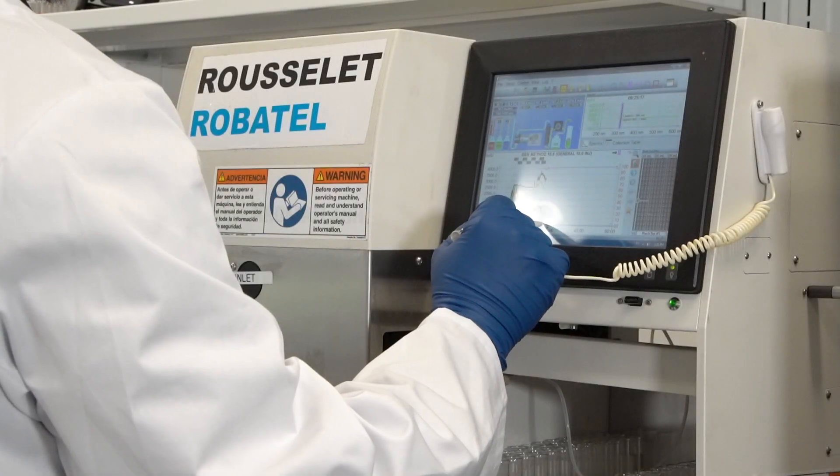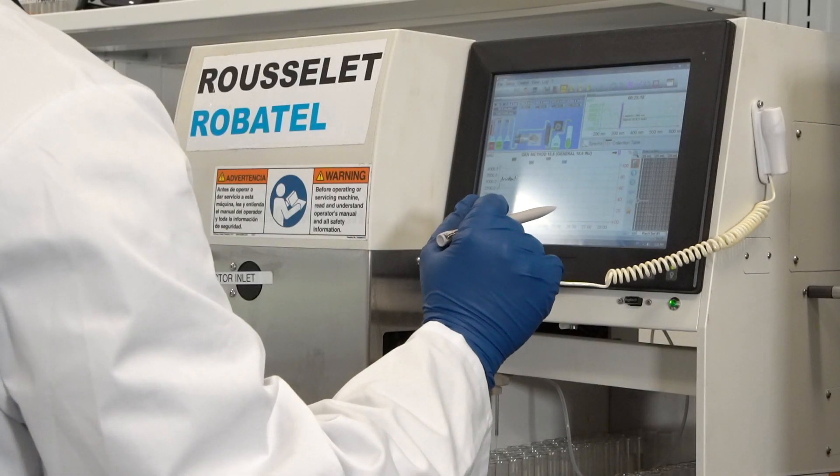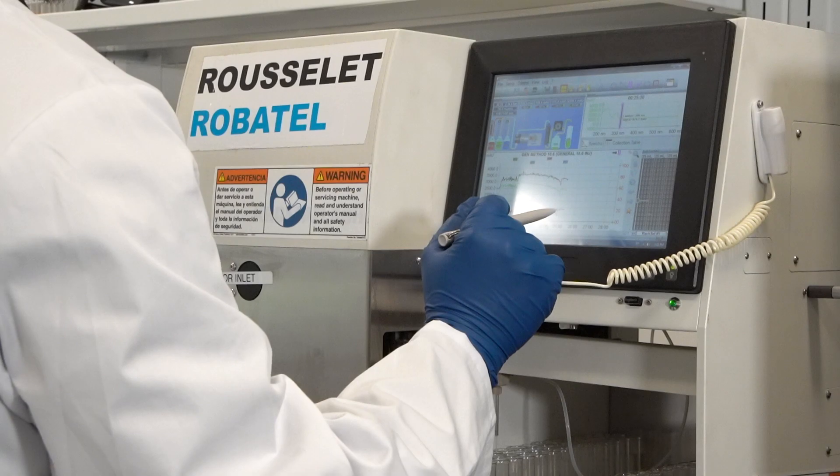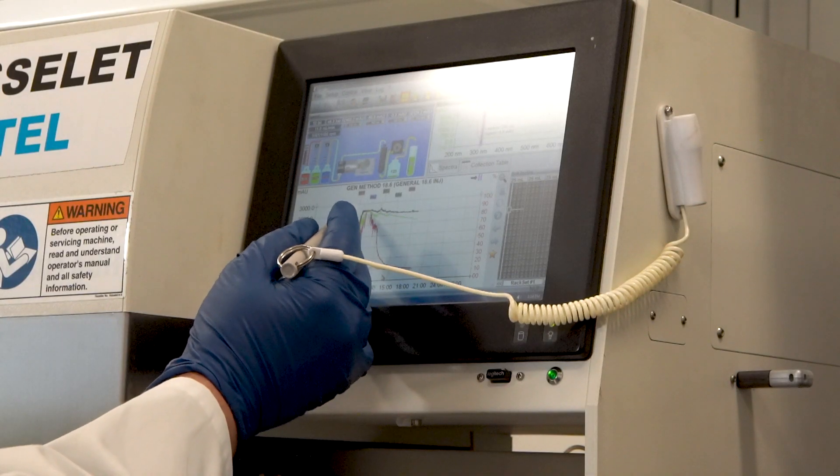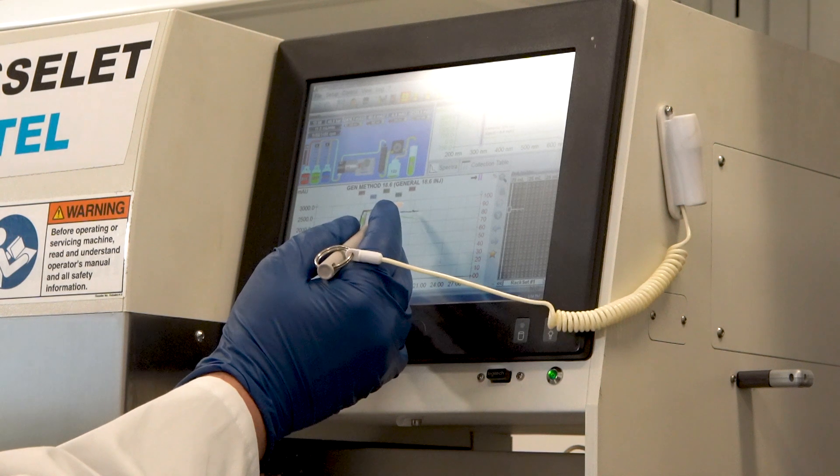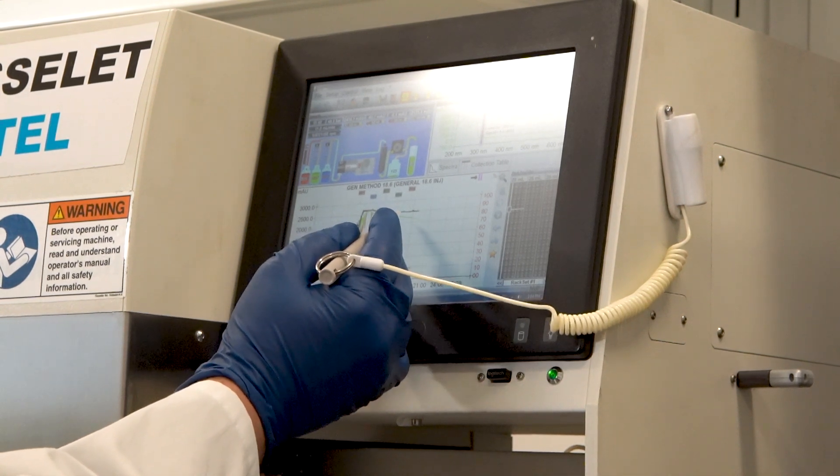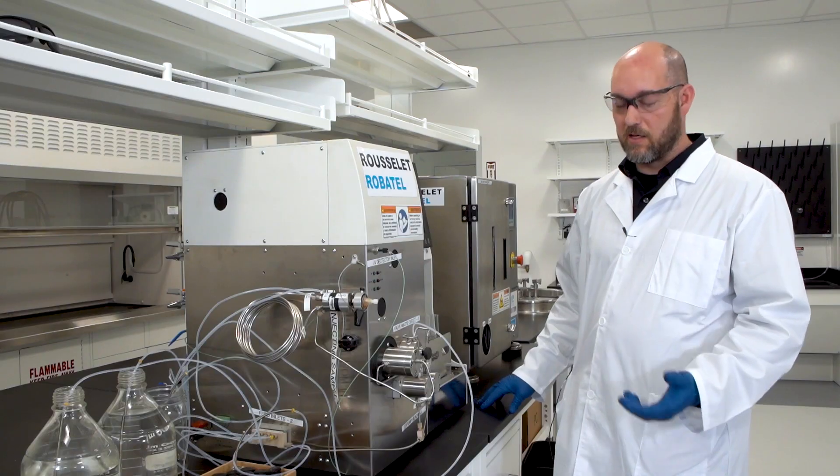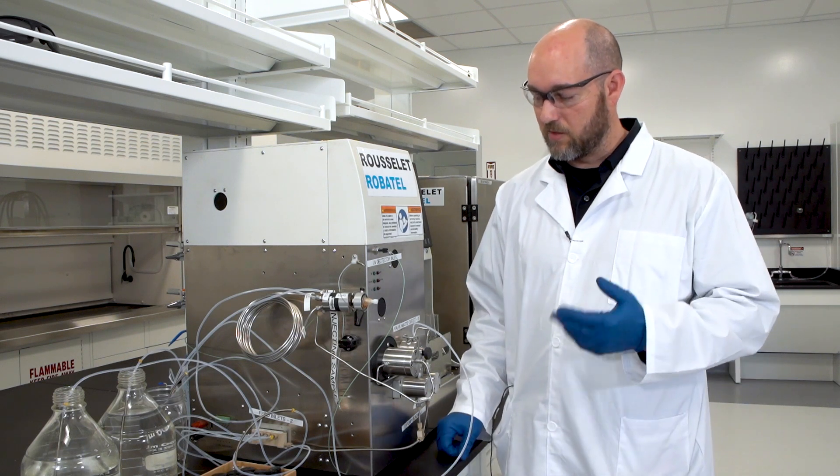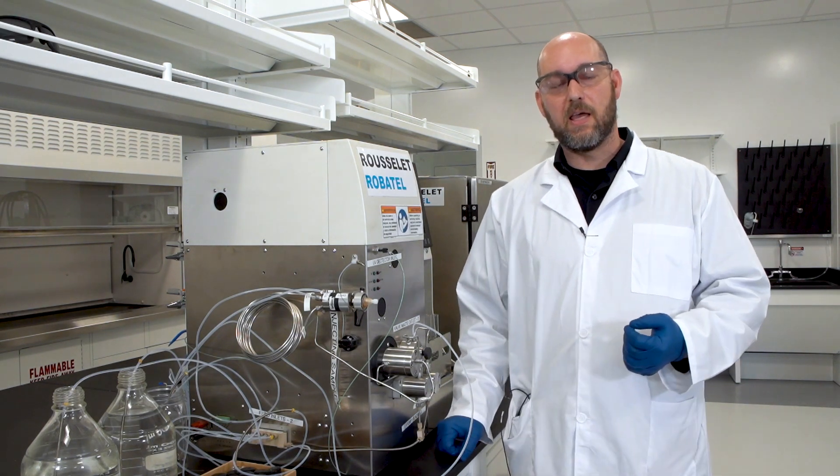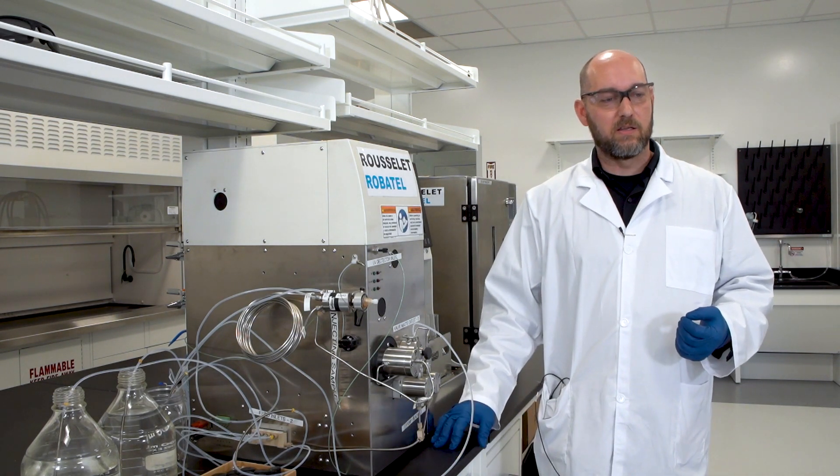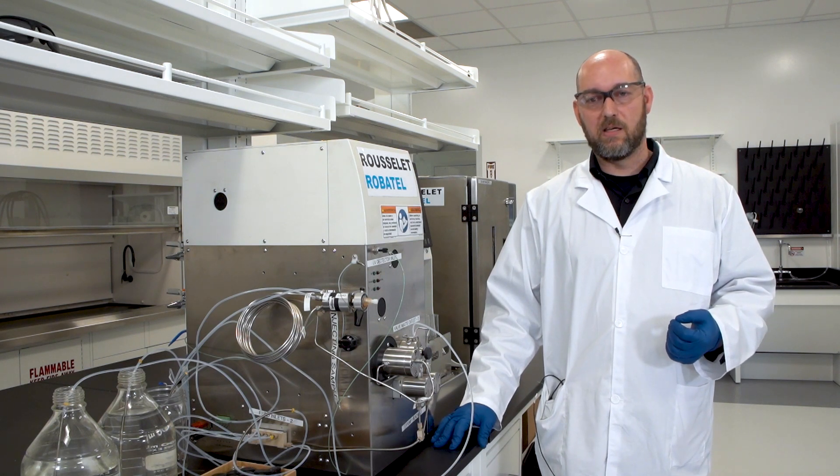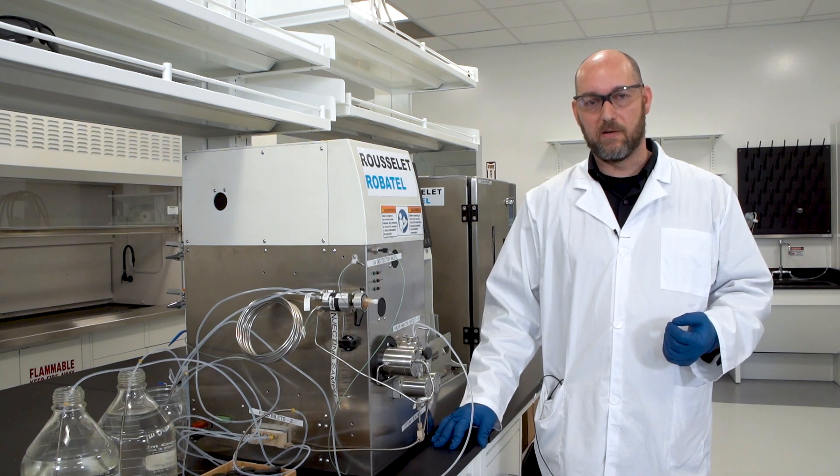In a general sense, the technology of centrifugal partition chromatography takes similar molecules and through many liquid-liquid separation stages is able to pull the similar molecules away from each other based on small thermodynamic differences in the molecules. In the case that we're doing today, the injection I'm about to do is a CBD distillate that's approximately 70% CBD and 2% THC in it.